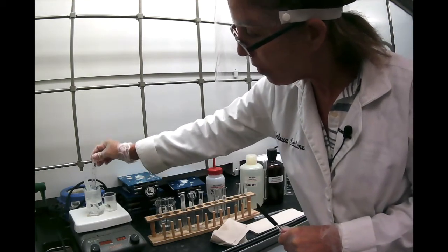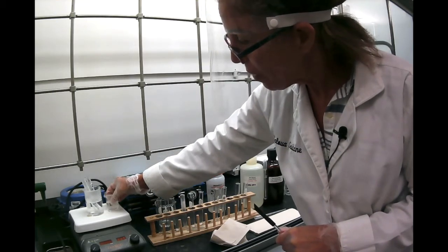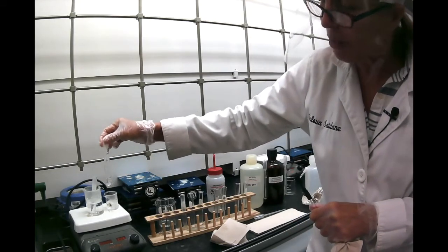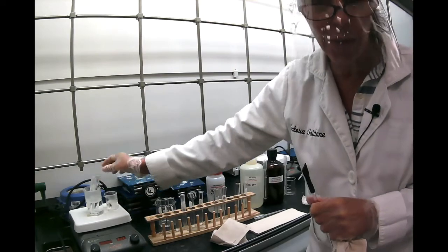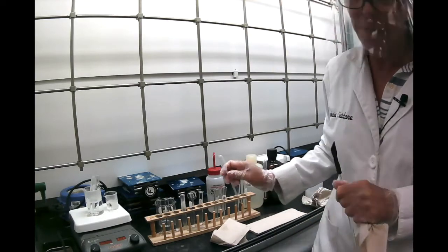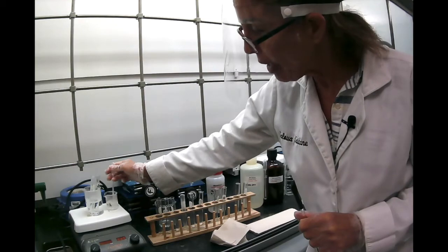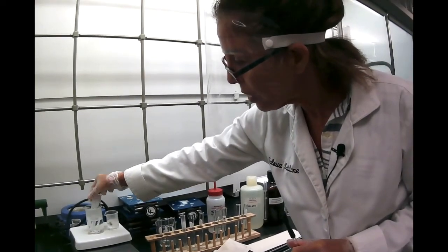Benzoic acid, though, feels like we need to add a little bit more hot water. But with benzoic acid, if it doesn't dissolve, by the way, it means you probably didn't have enough water, so you really need to reach that saturation level. So you don't just give up and say, okay, it's not soluble. Add a little bit more and see if it dissolves. And make sure, of course, your solution is hot.